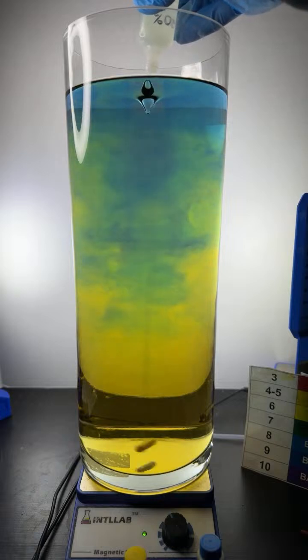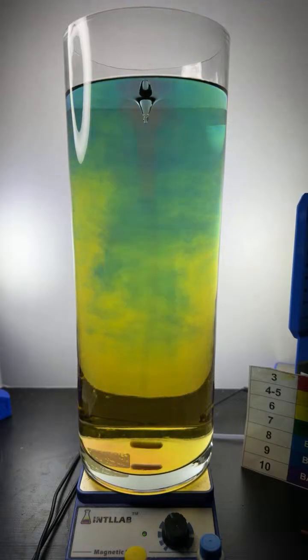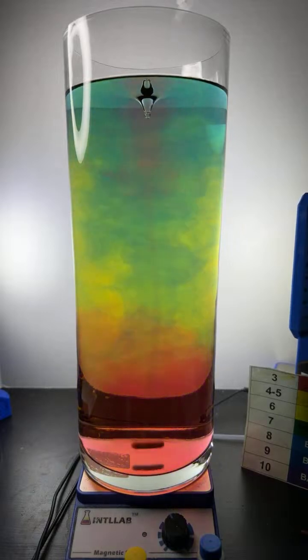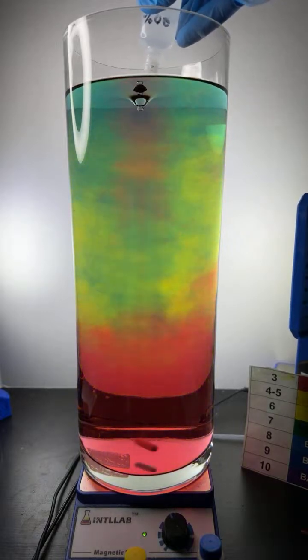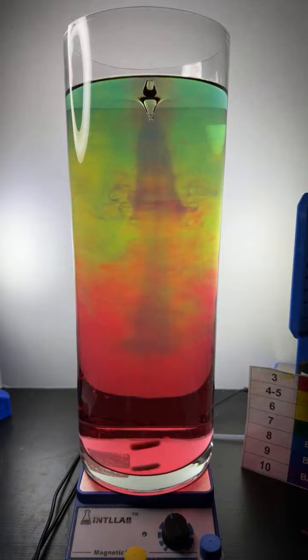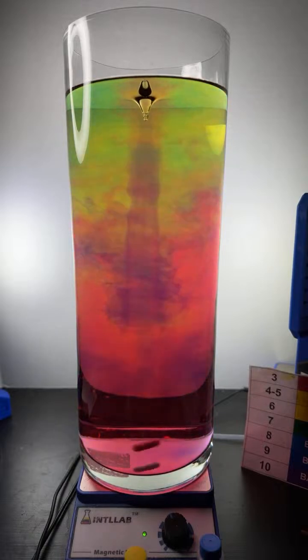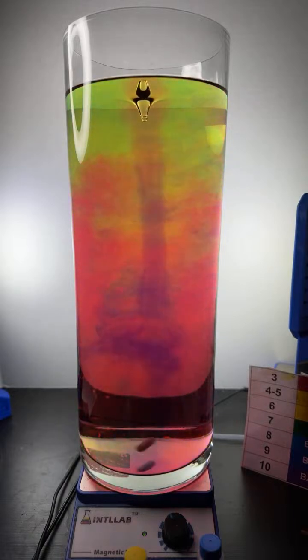Let's go ahead and add a little bit more acid here. Try to get some red color to develop. And I'm going to add a few drops of base around the outside. No, maybe I'll just chase it with base. Here we go. Look at that. Come on, that's gorgeous. That is just some beautiful color that's growing in there. Absolutely beautiful.